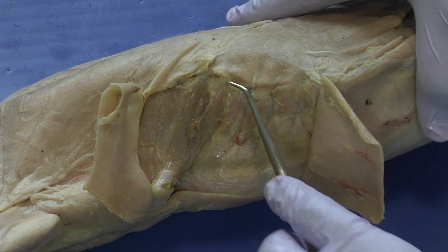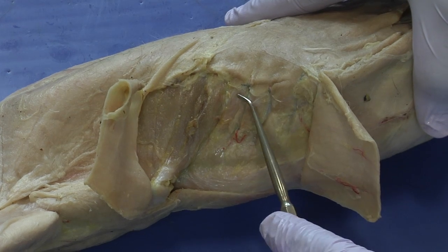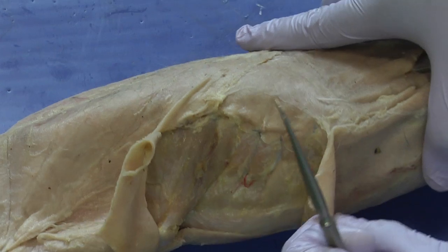That needs to be cleared off, so I've cleared off quite a bit of it already. In order to see these muscles, you have to clear away the fat.